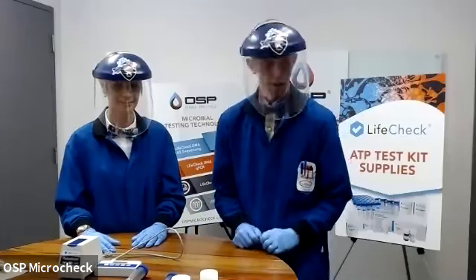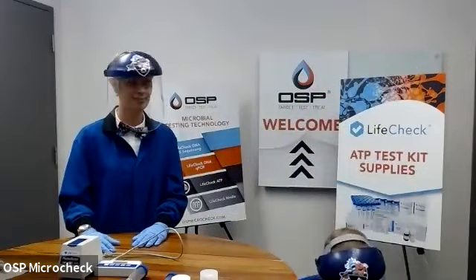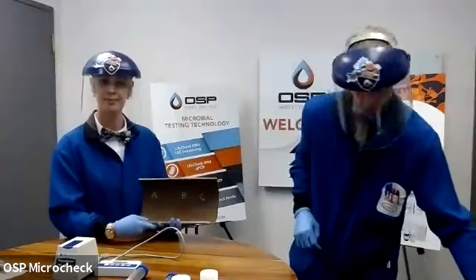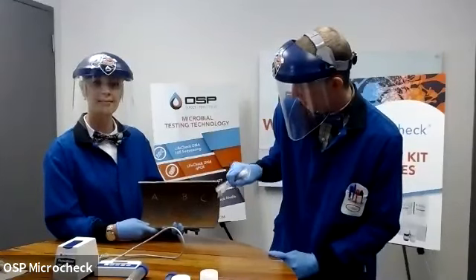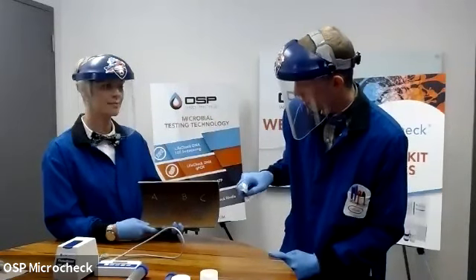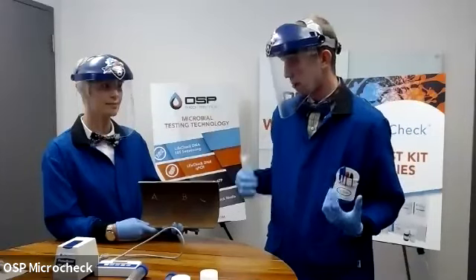We do have one other application for that sessile testing kit, and that is swabbing. So I have here a pipeline cutout. And in the position just below the letter B there is a fairly aggressive pit. If memory serves right, this pit was about a 70% wall loss that occurred over just a few months. So there was some aggressive corrosion happening here.